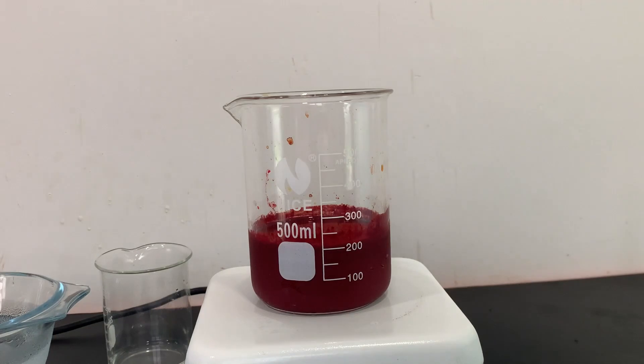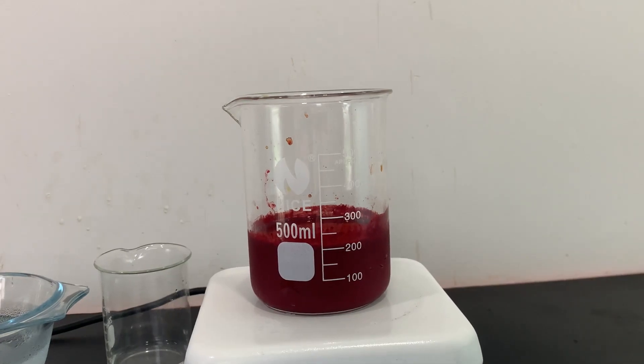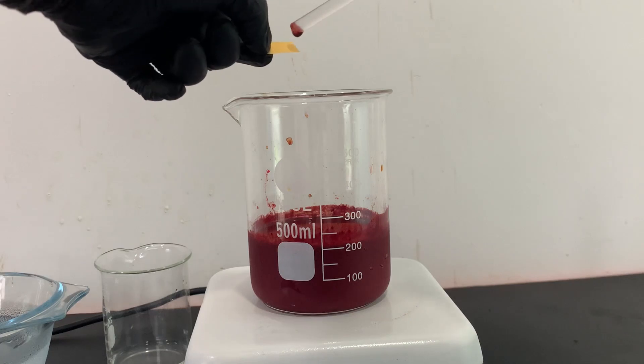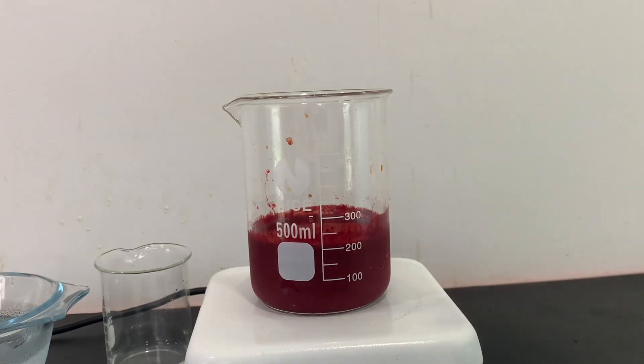I took the beaker out of the ice bath and let it warm back up to room temperature. In this step, I have to make the pH of the solution basic. The pH of the solution right now is acidic.